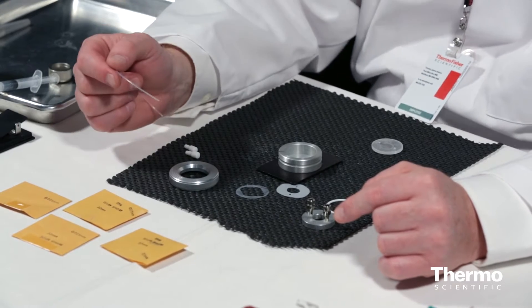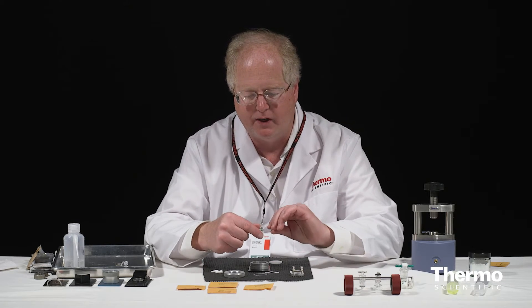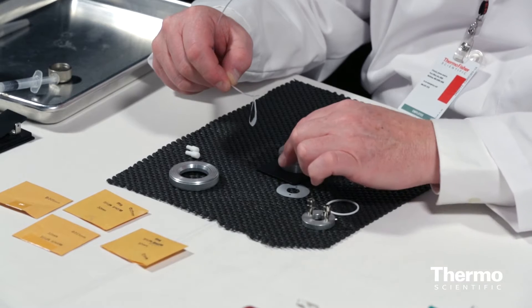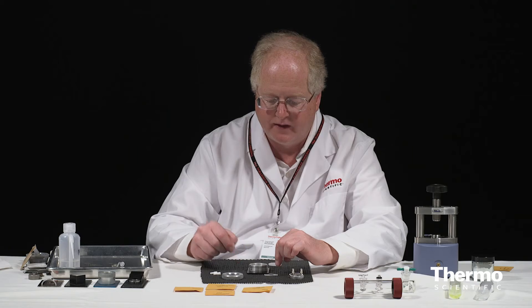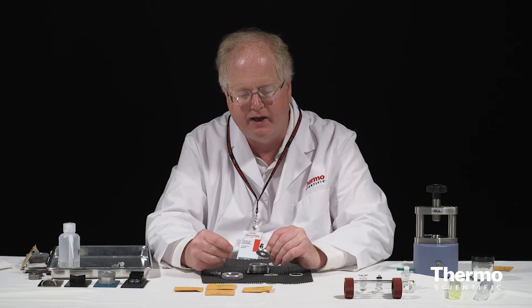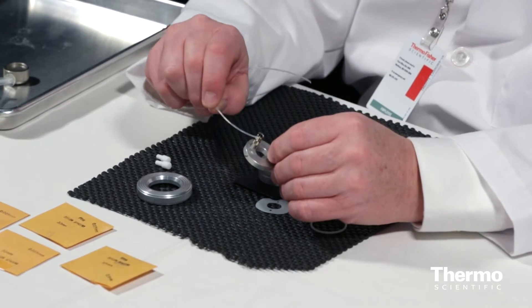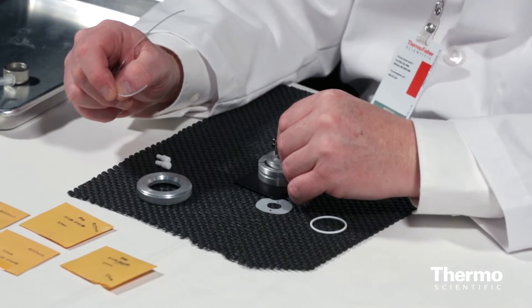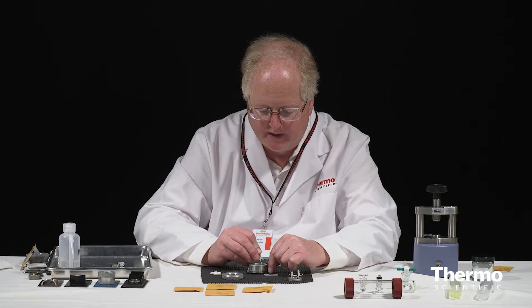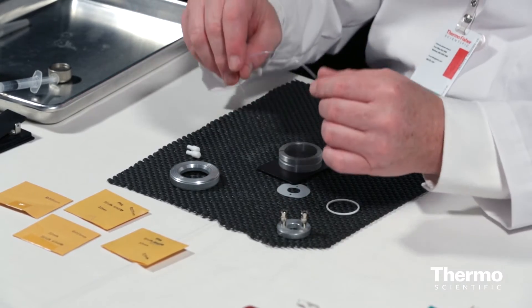The one I'm going to use is the 15-micron spacer, because the liquid I'm using — methanol — has a very high absorptivity, so I want a short path length. I'm going to pick it up using a piece of tubing and lay it down in the cell. The orientation of the cell is controlled by a pin on the outer portion with the syringe connectors. The spacer is oblong, so I want to make sure it orients across the long axis of the cell.